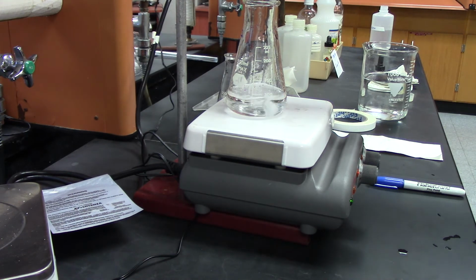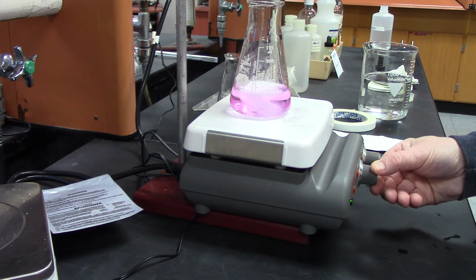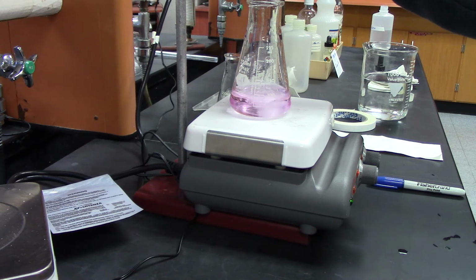Okay, it's a little bit more. Okay, that might be it right there. Stir it up. Oop, I probably want it just a drop more. Maybe a couple drops.